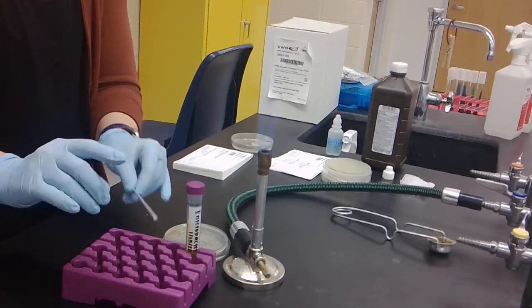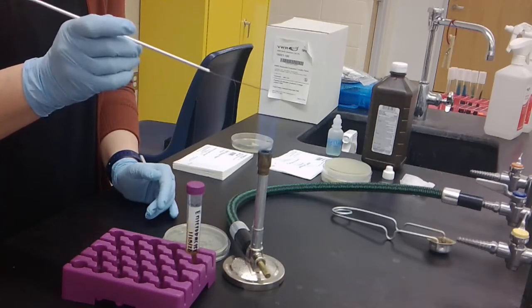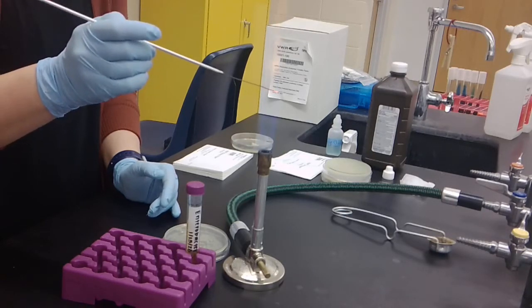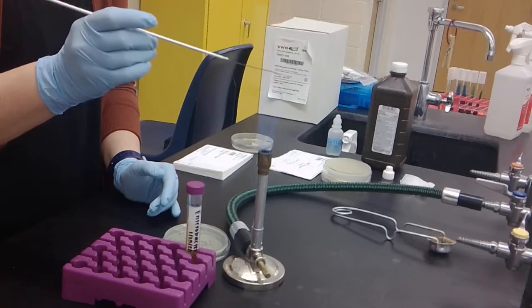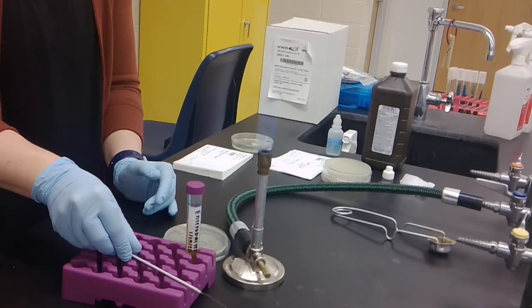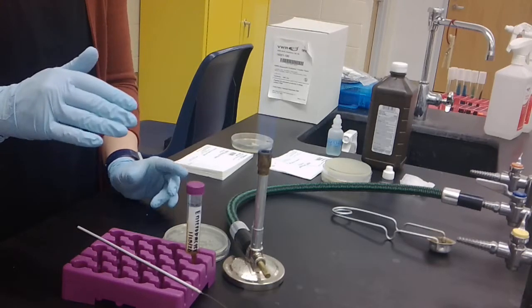You're then going to incinerate your loop, letting the entire loop get red-hot, like we've talked about before. And then you're going to either hold it in your hand or sit it on something so that the loop itself is in the air and doesn't touch any surfaces.